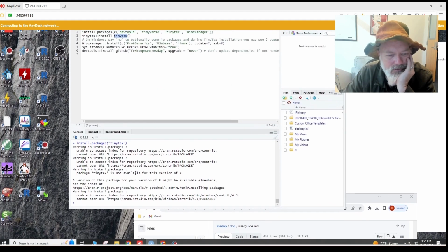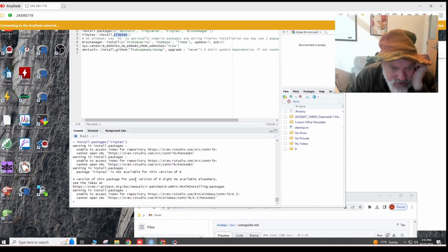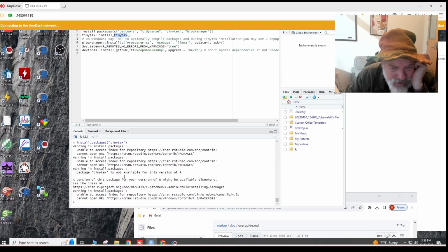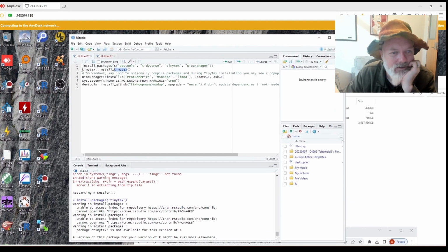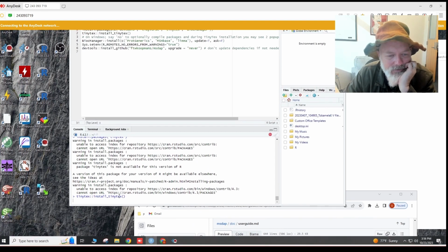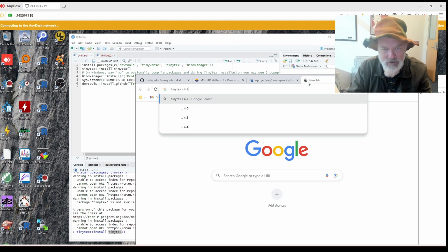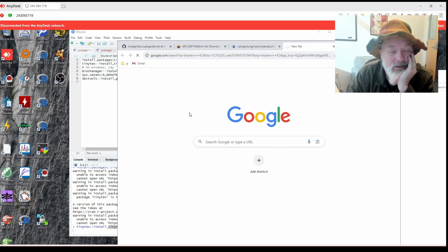Okay. All right. Unable to access index for repository. Oh my gosh, this is really... Unable to access. Why? A version of this package might be available elsewhere. Oh my god, this is so annoying. So did it not work? Let's see. I think we have to download it. I think I updated R to 4.3 and TinyTeX is not available for 4.3, and sometimes it will give us instructions on how to fix it. Ugh.